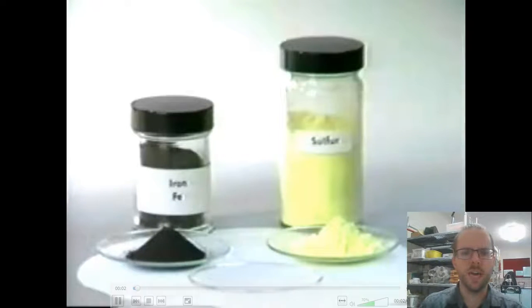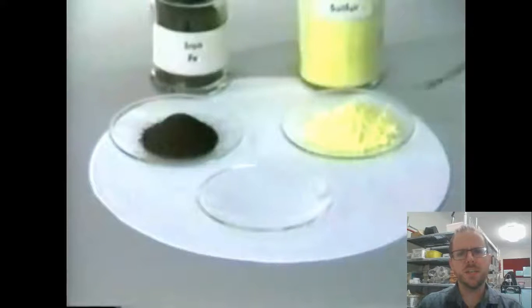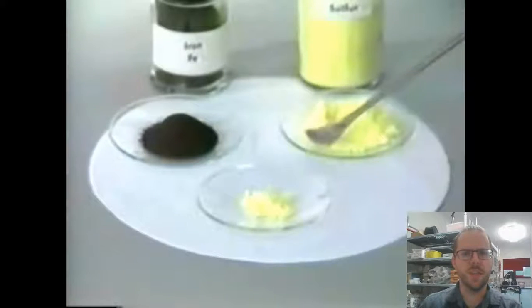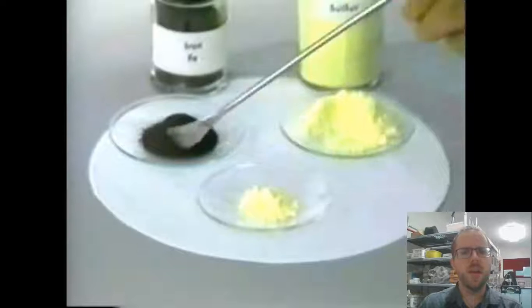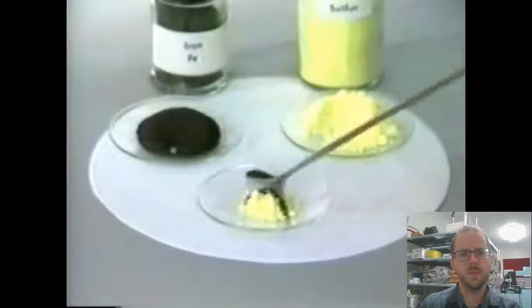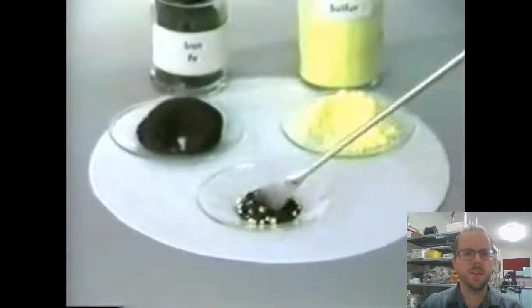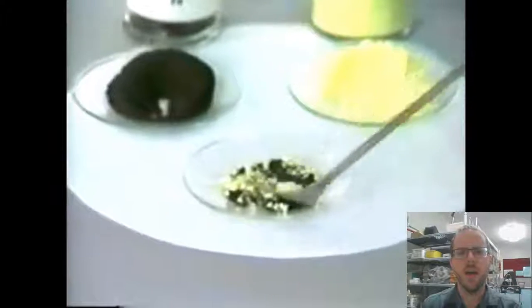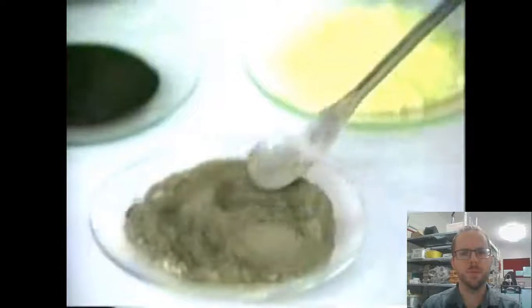So what we have here, we've got canisters of iron filings and sulfur. Okay, so you can see them on the little watch glasses in front. So if we take a certain amount of sulfur and put it into a sample, and then we're going to take some iron filings and mix the two things together. Okay, so getting a decent amount of both samples, and then we're going to use the spatula to thoroughly mix those two things to a singular kind of coloured powder. So better mix than the sample that we had, for example.